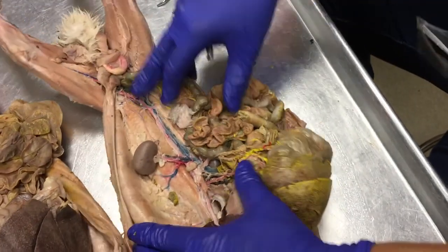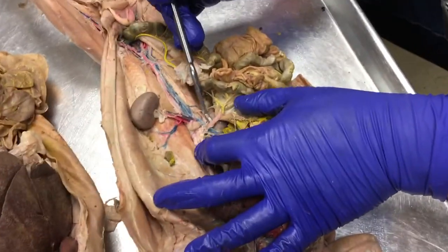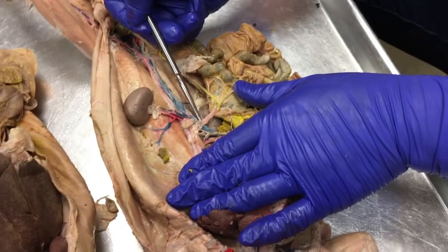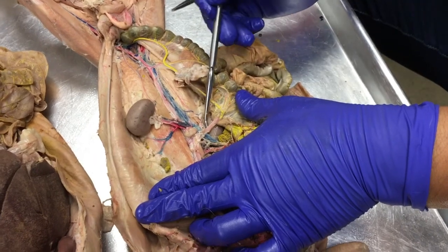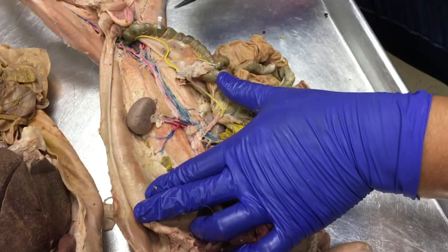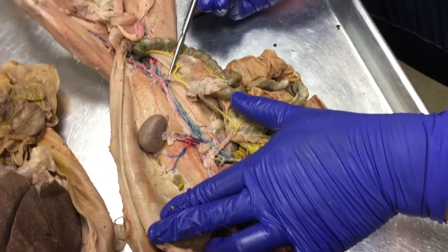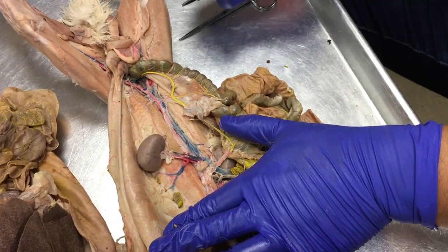As we make our way down this abdominal aorta, we'll see there's another branch. It's a pretty big branch going toward these anterior intestines. This is the superior mesenteric artery. Both the celiac trunk and the superior mesenteric artery are not paired. There's only one. That's also true for this little artery going right to the colon, the inferior or posterior mesenteric artery. There's only one of those. Most of the rest of them have pairs.